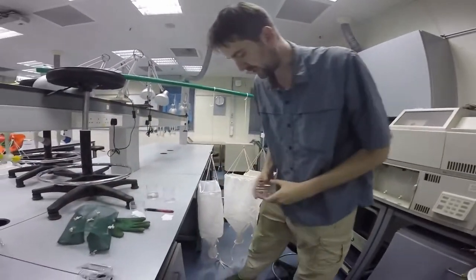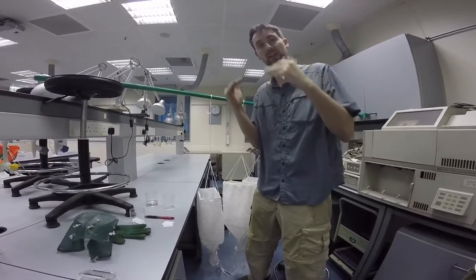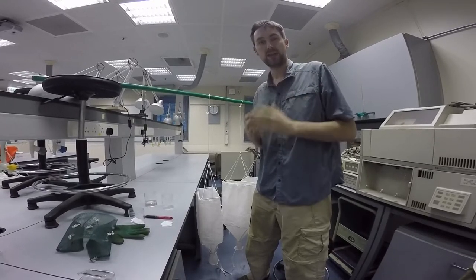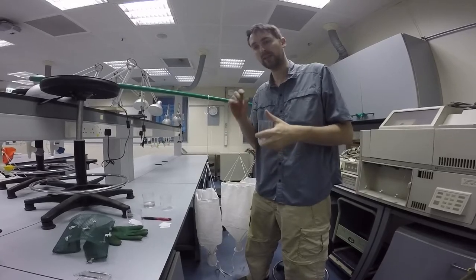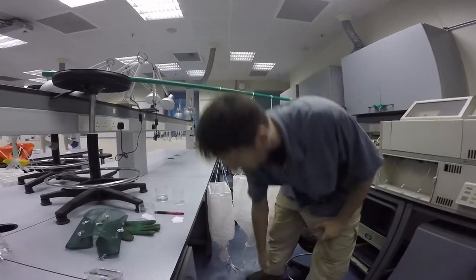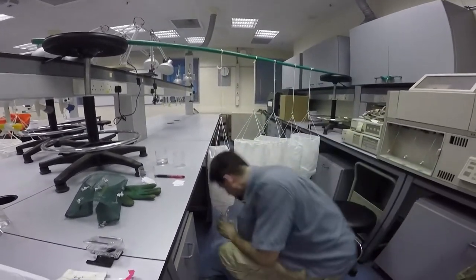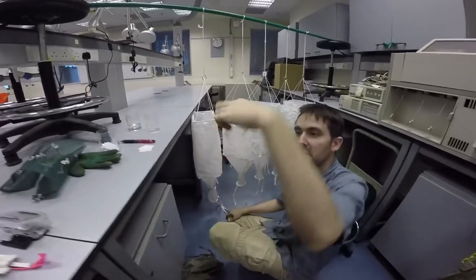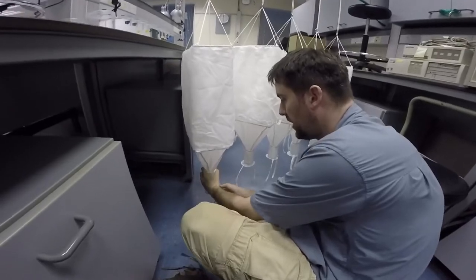The first step is to prepare our sample so we're going to minimize the amount of organic matter that will fall, because I like to sort through insects. I'm not so happy when I have a big, thick mud to sort through and try to figure out where the insects are. So for doing that cleanly, we're going to place an empty cup here at the bottom of the Winkler bag, right here.